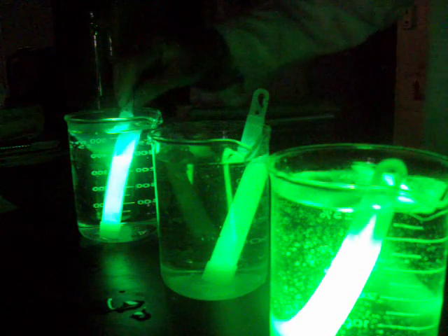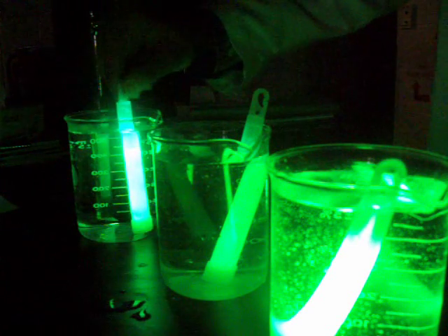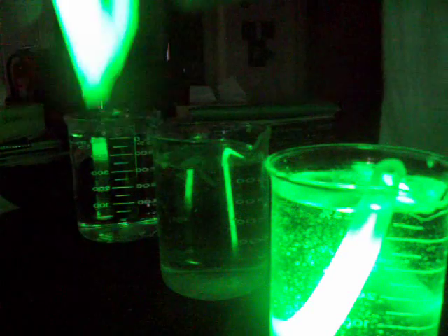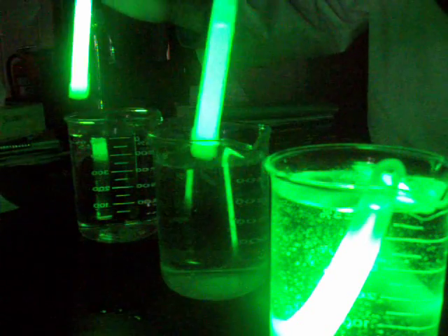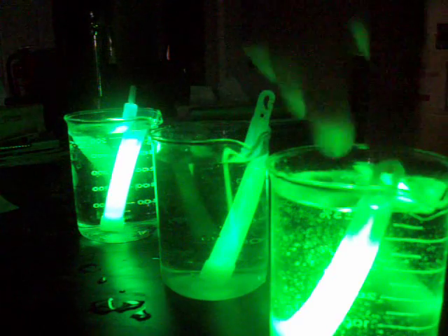The one on your left, that is the hot one here, is getting noticeably brighter. And already it's brighter than the room temperature one, when just a moment ago it was dimmer than the room temperature one.